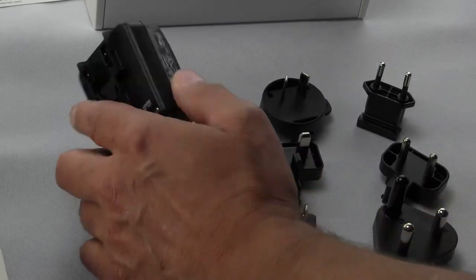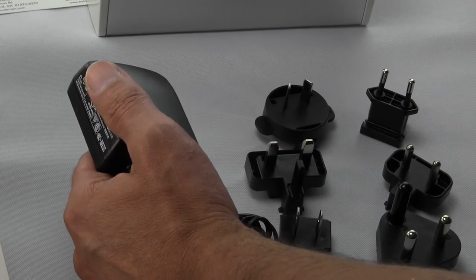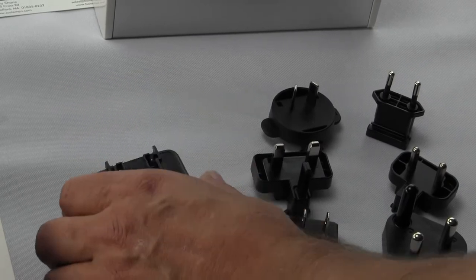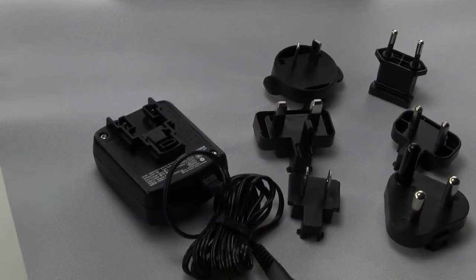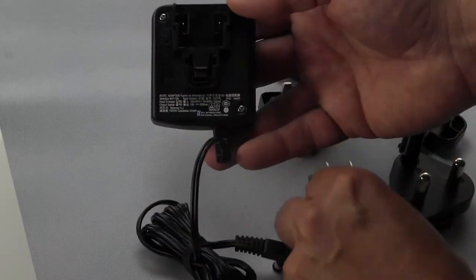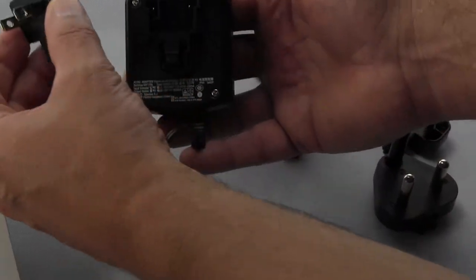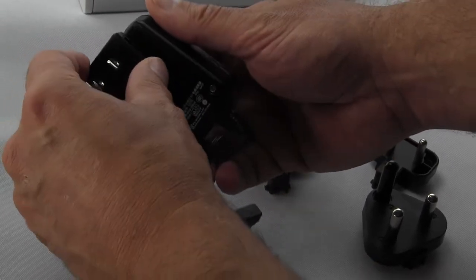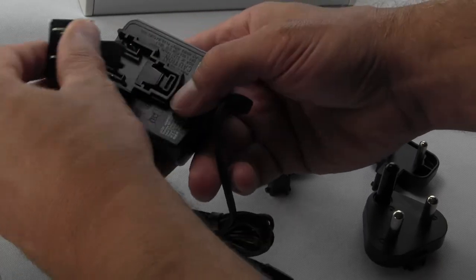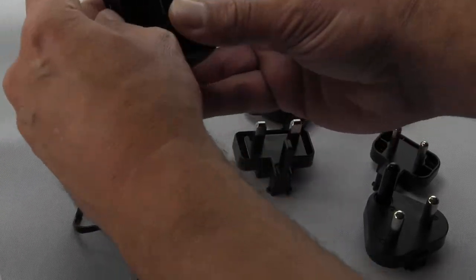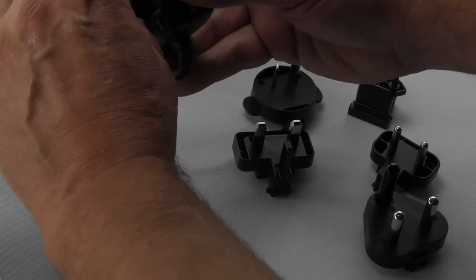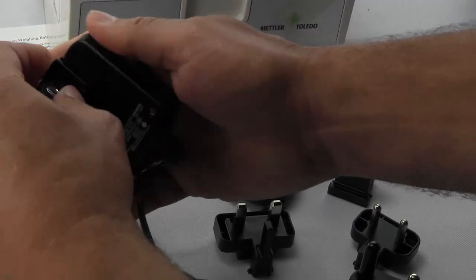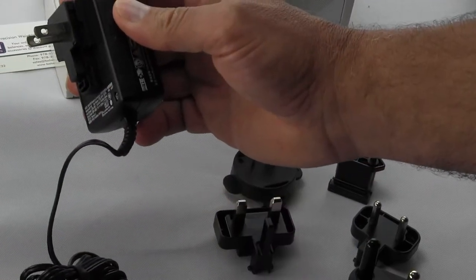The AC adapter is IP40 for dust and splash resistant, so it's a high quality adapter. Depending on your country, we're in the US, so you take this module and put it into the holes, then there's this tab that clicks down into position. That's your power supply.